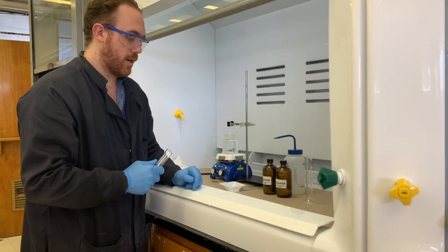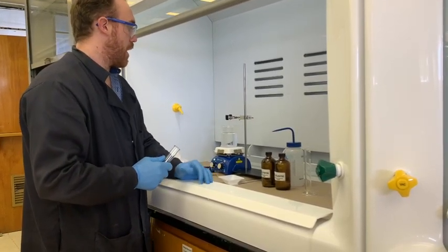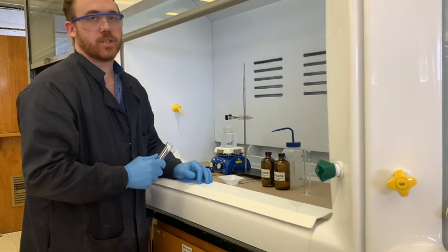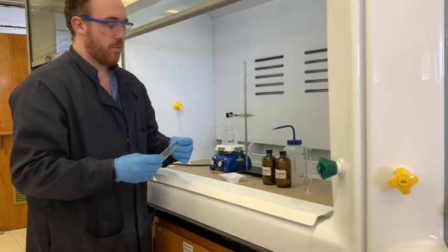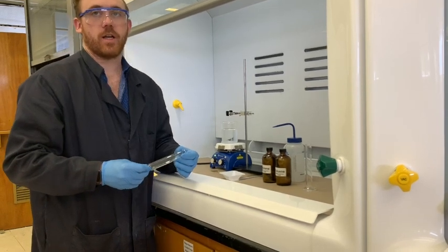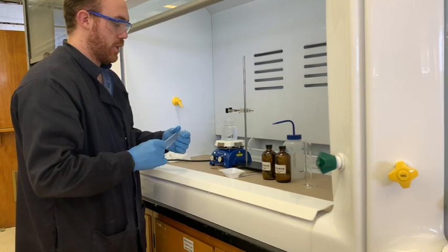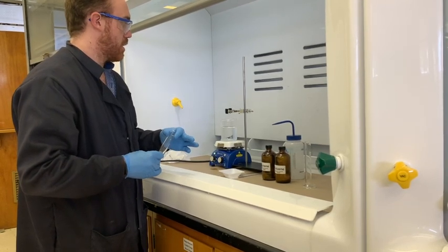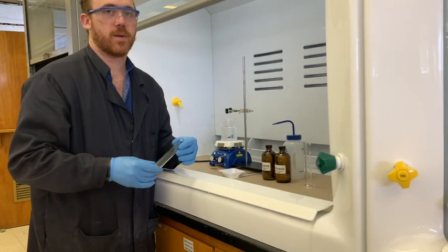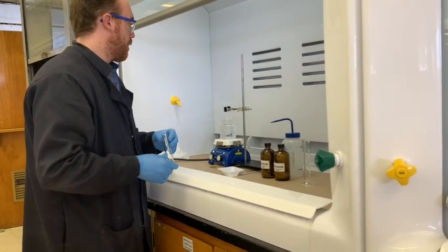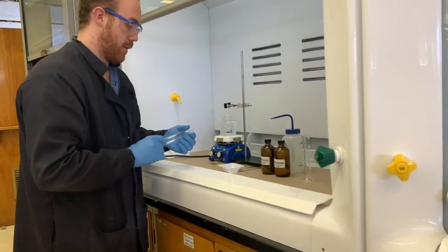Now, when it comes to any kind of radical reactions, you want to be very careful about what you add and how fast you add it. Radical reactions can get really nasty really fast. So, just before you add the radical initiator in any future reactions, if you're doing any kind of radical initiations, you want to just double check all of your procedure very carefully first to make sure you're not going to potentially create anything explosive because sometimes that can happen in radical reactions.